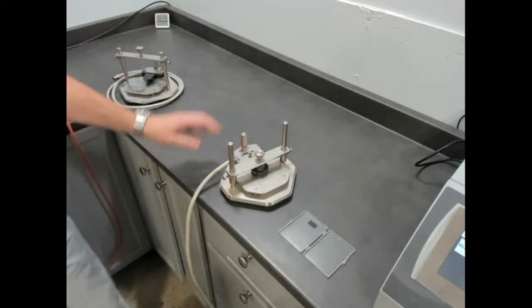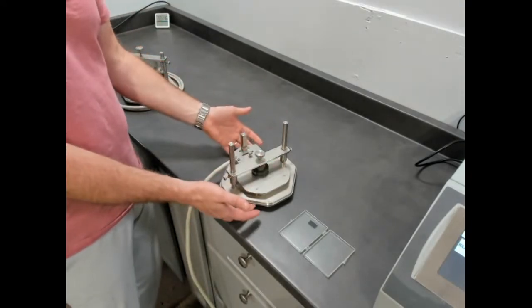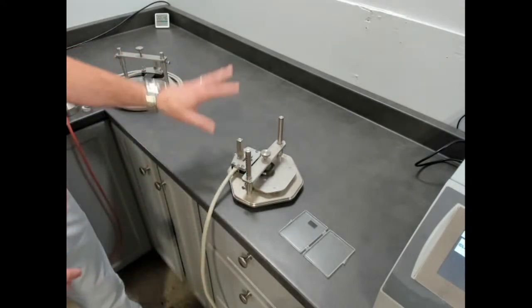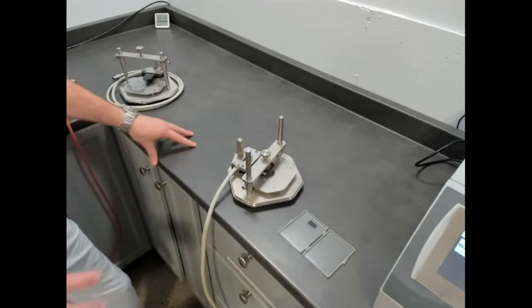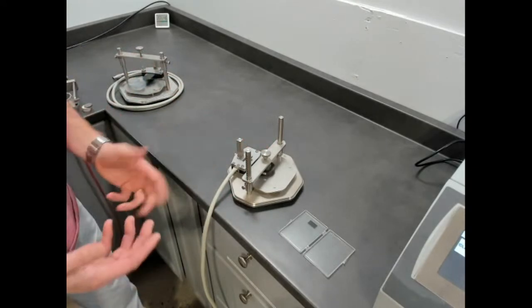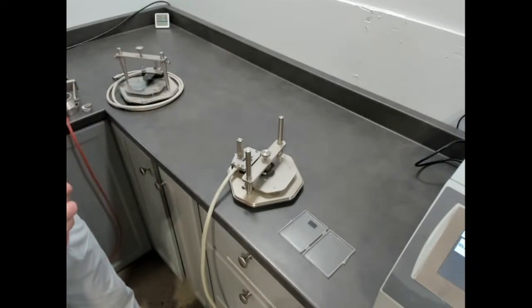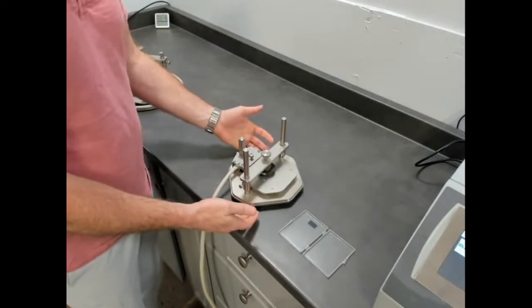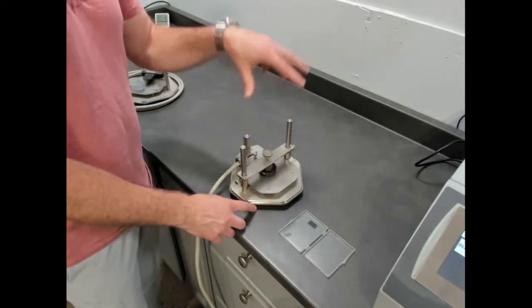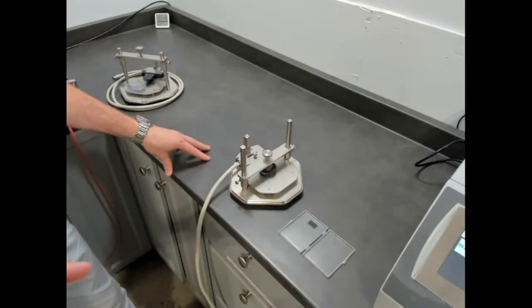That's our configuration for room temperature, or if we had the upgraded adapter for 300, we would put this in an oven. We have ovens that communicate with the software so that you can run this all fully automated as well. So the temperature platform has many advantages over this because it's from the ground up designed to be fast and accurate and small and compact and controlled multi-channel. But when you need to be able to measure large samples, of course, it's nice to have this option. So this is the transient plane source sample holder for benchtop and sample setup for the temperature platform.